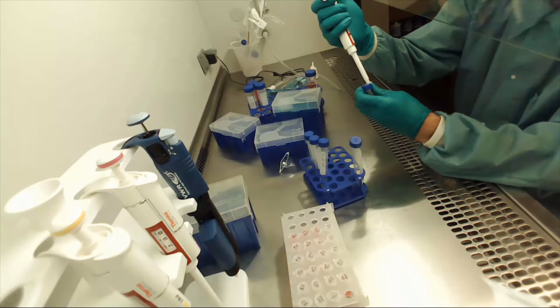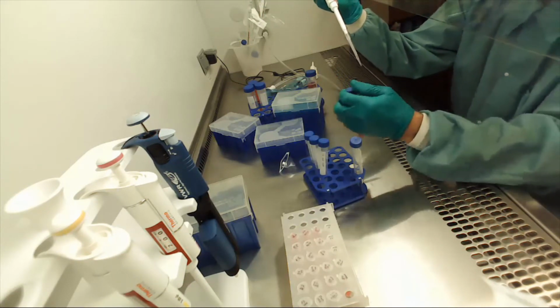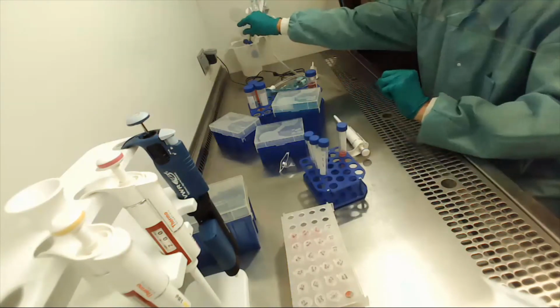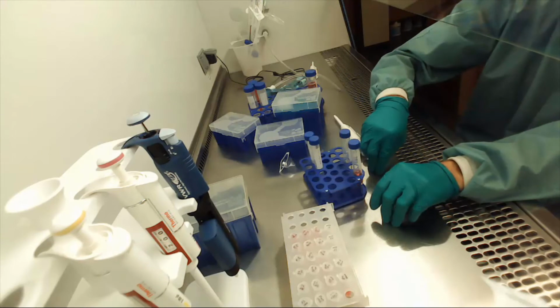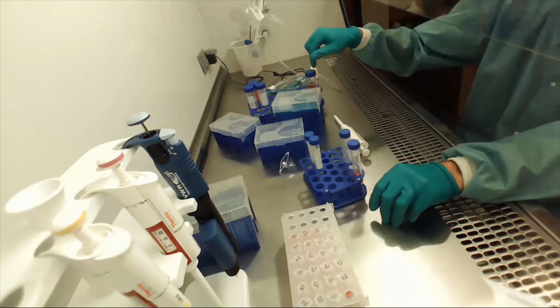I'm going to mix it up pretty good. Okay, so that was the easy one. You do the rest of the math the same way. Okay, so now I want to go from 27 or 22.5 down to 18. And so my calculation was I need 3.75 of this, and I need 1.25 of this.